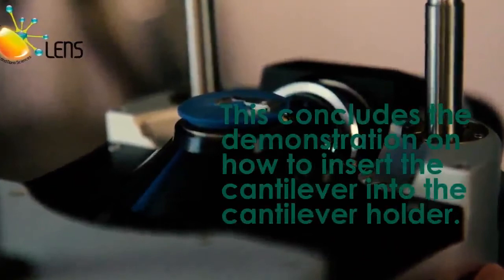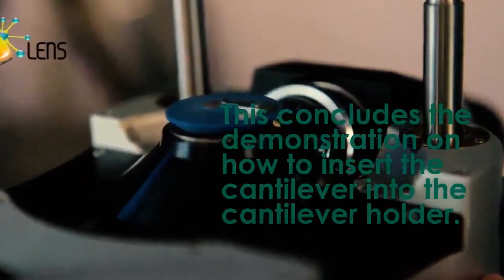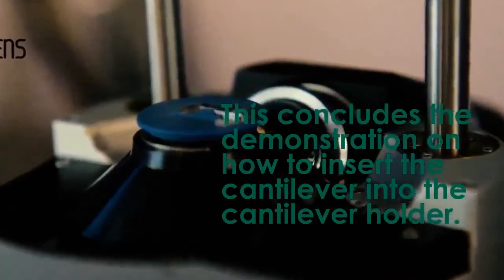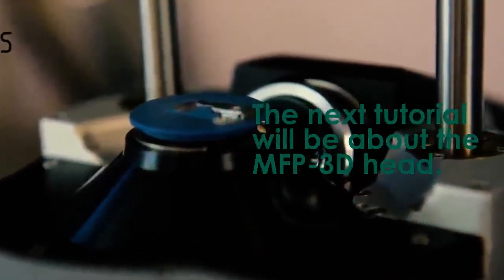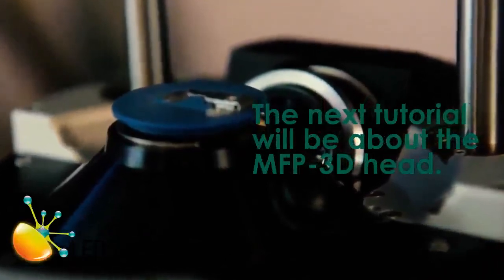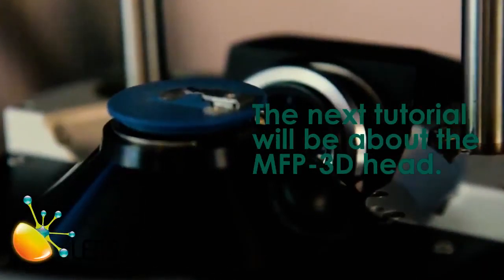It is advisable to replace the cantilever after every usage. Using old cantilevers might compromise your data, leading to noisy images. Also, ensure to store the cantilever at room temperature for optimal performance. In the next tutorial, I will be talking about the MFP 3D head. Thank you.